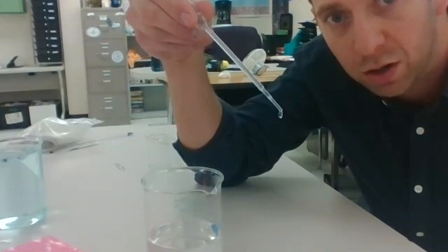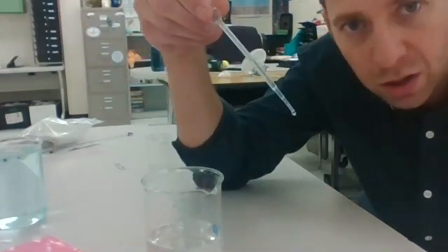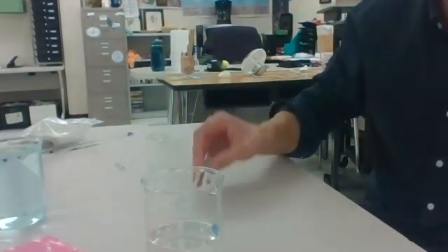Drops of water and drops of alcohol. I think the alcohol drops do look a little smaller. But anyways, alcohol was not able to hold on to other alcohol molecules the same way that water was. Okay, so go ahead and pause the video and answer the 3 questions on the lab document.